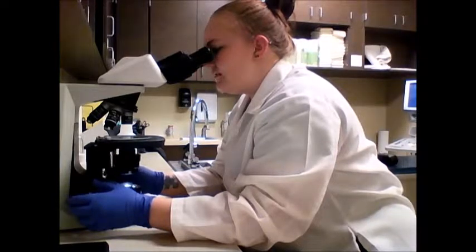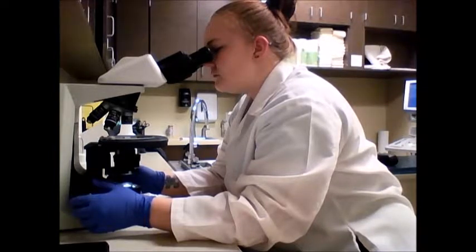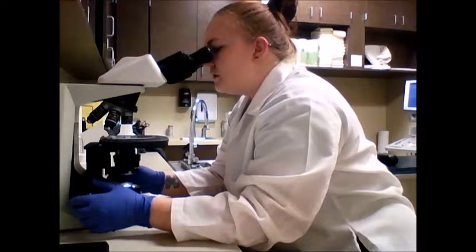Color, you can see everything very visibly. I don't see any outwardly large clumps anywhere so far.